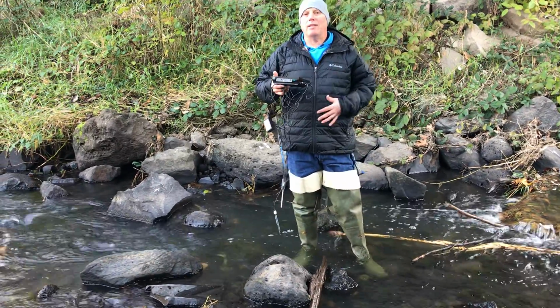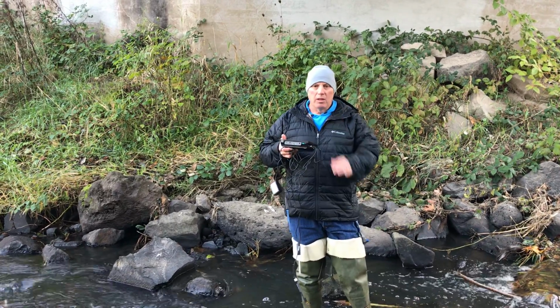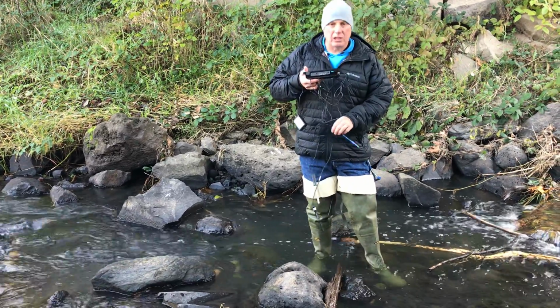So you're gonna wanna write this down, okay? I have the data table there for you. Go ahead and make a data table, write that down. So we'll start with there. Then we're gonna go to our pH. So my next one we're gonna check is the pH.